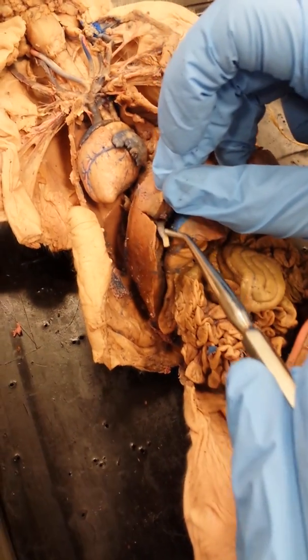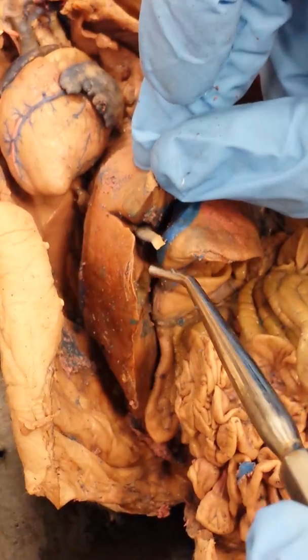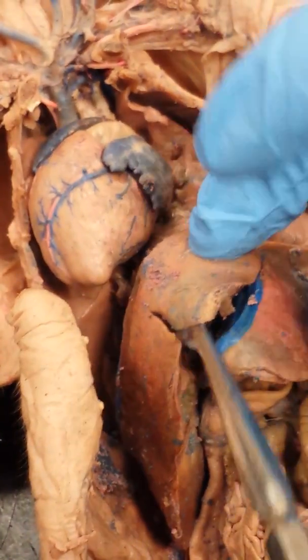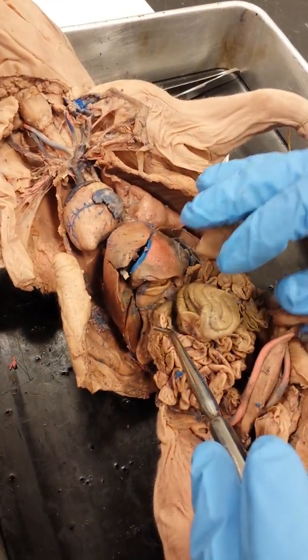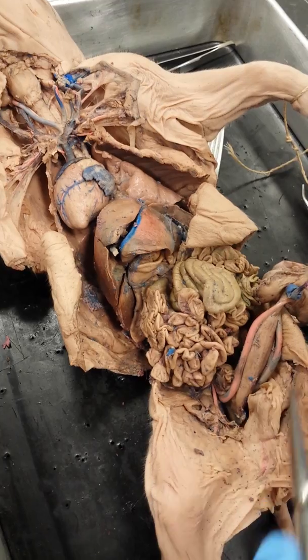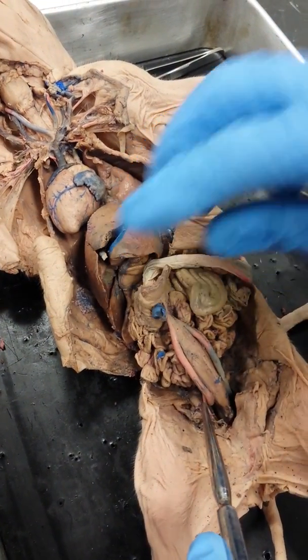What you want to understand is that the umbilical vein is carrying oxygen-rich blood. Alright, so vein means you're going to the heart, while you're going to the fetus with oxygen-rich blood from the mom. So it's under the gallbladder, but not part of the gallbladder? Correct. Okay. Now, I'm not looking for any veins in the pelvis, and you can look for those on the picture, but I'm not going to test you on the actual pig.